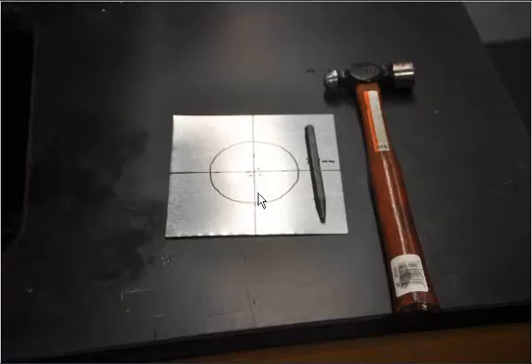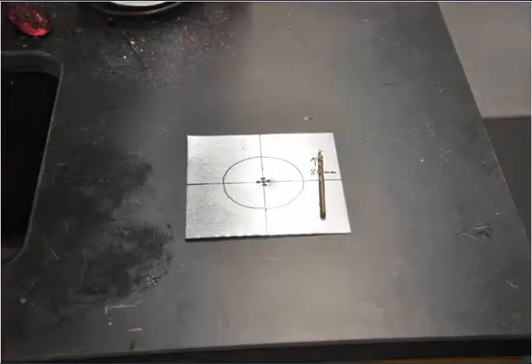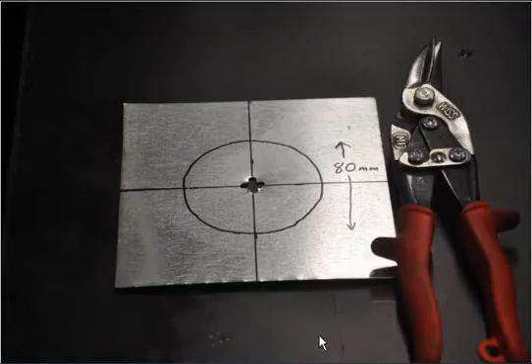So we take that, and we're going to center punch about five holes right around the center so that we can drill those out, and then cut that out with the tin snips, just cutting from hole to hole to hole to make a larger hole. You can also just drill a larger hole, but then you have to have access to a large drill bit, which are a pain to come by.